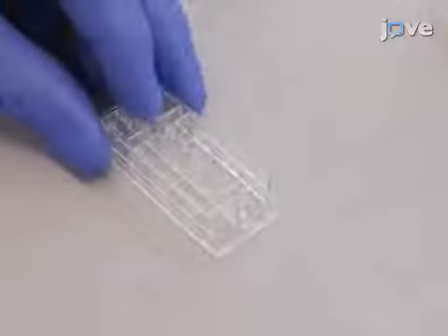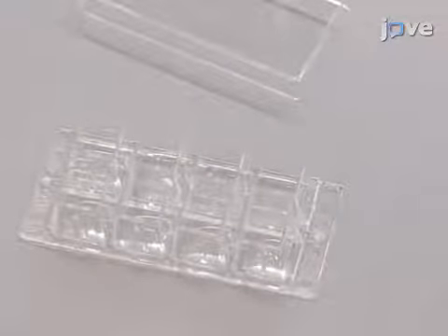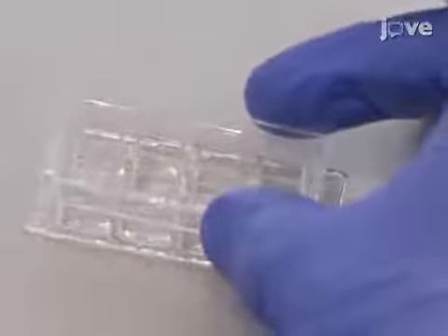After preparing a Con-A treated 8-well glass-bottomed chamber slide for imaging according to the text protocol, add 200 microliters of YNB medium lacking additional nutrients for plasmid selection to each well.